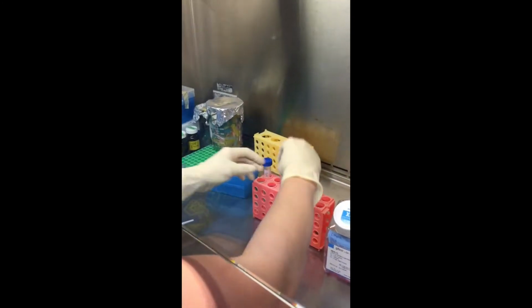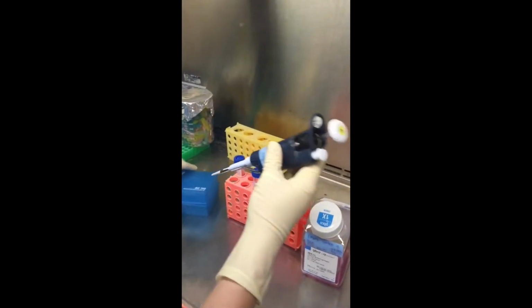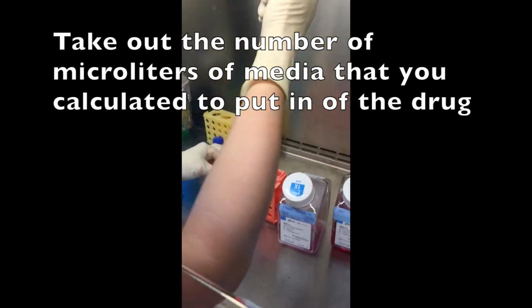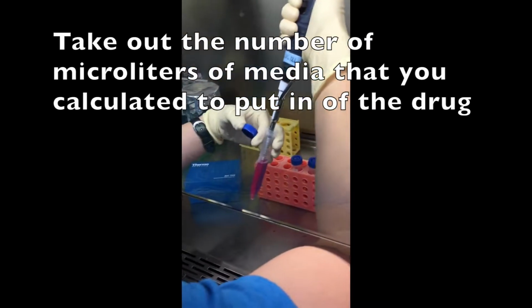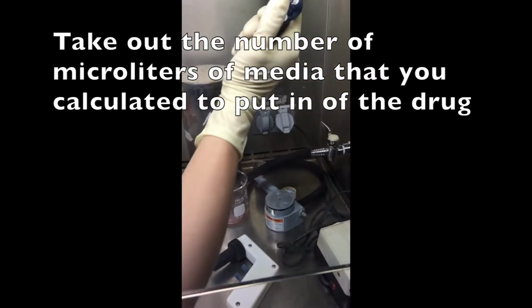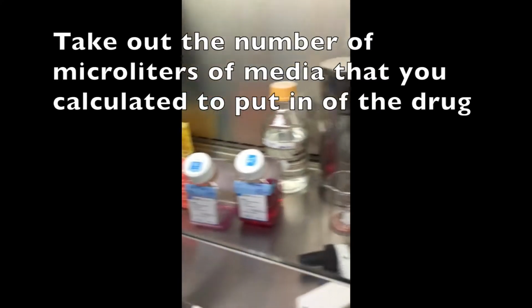Okay, so now the untreated one is complete because there's not going to be any drug in it. The 20 micromolar, remember I said I'm adding 16 microliters of drug. So the first thing you need to do is take out 16 microliters because we still want our total volume to be 8 milliliters. So I'm just going to eject the tip with the media into my beaker.